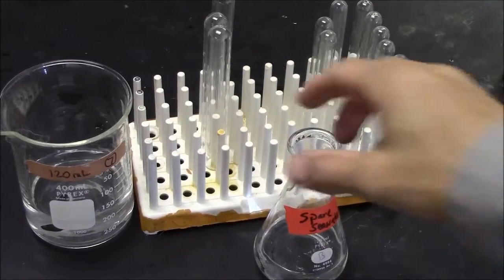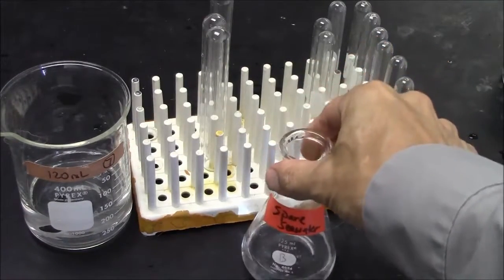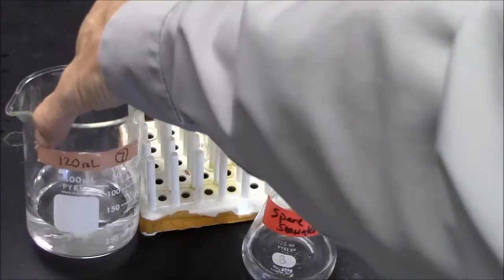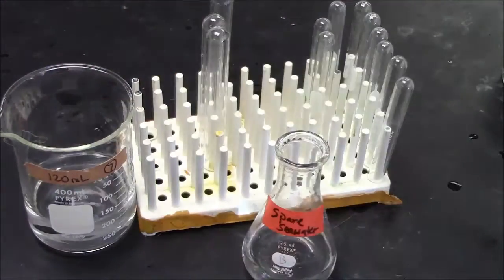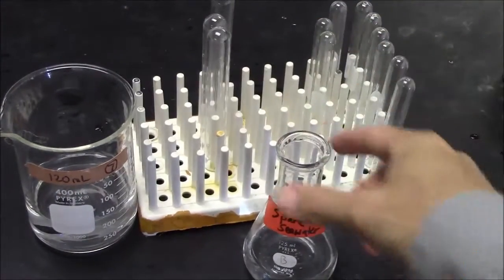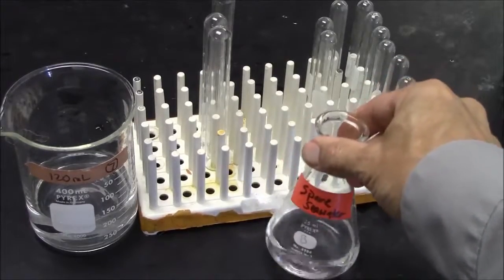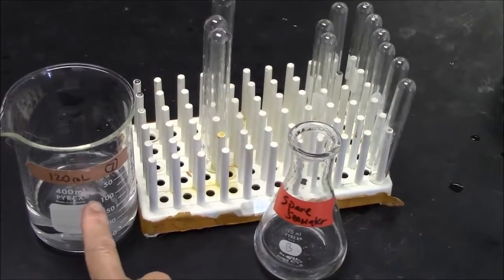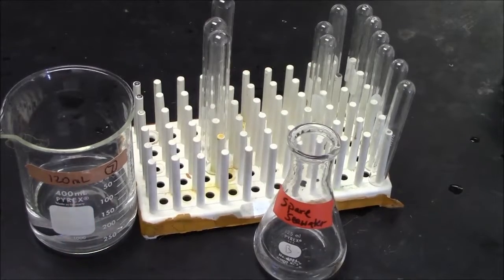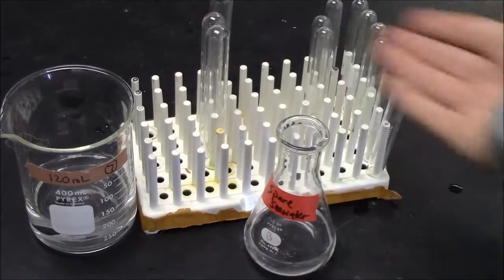I've given you a flask that says spare seawater in addition to your flask with the measured quantity of seawater. You also have test tubes, so you can use this spare seawater to do experiments so you have some evidence before you commit your entire sample. Here, you can do some trials with the test tubes.